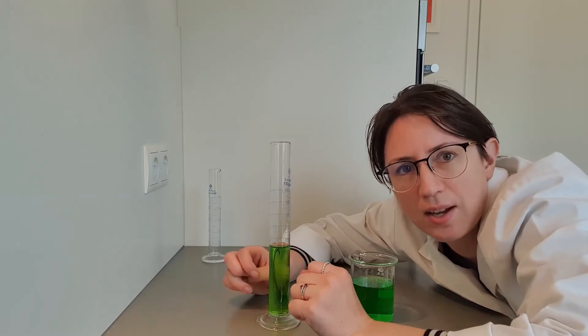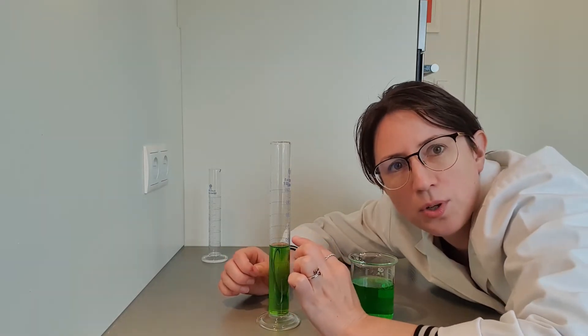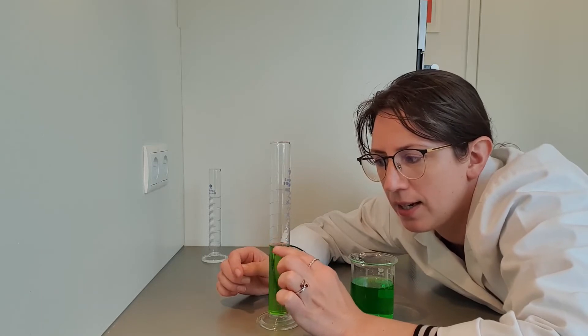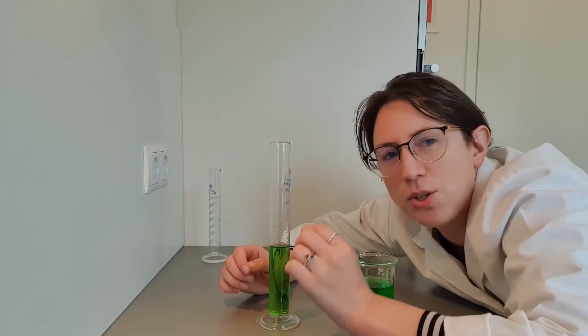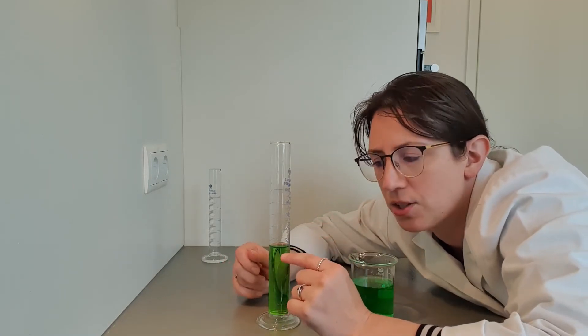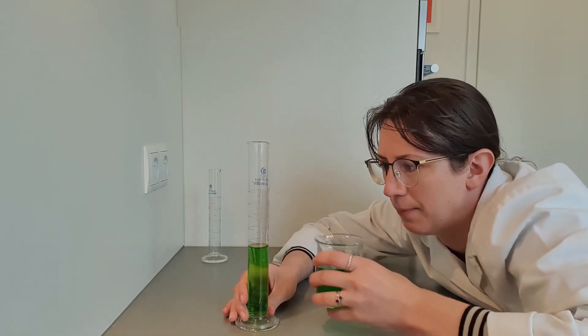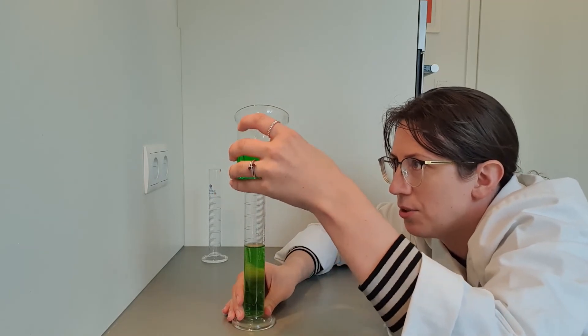The meniscus is where you see the water level in like a bent shape, so it's got like a little dip in it, and you want the dip, the lowest part, to touch the 60 milliliter line. So let's see if I can do this.